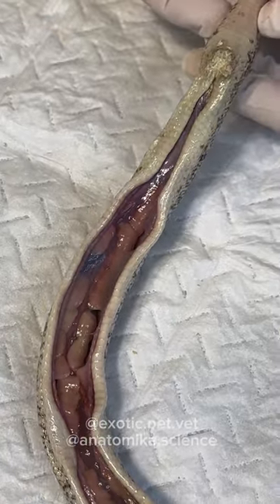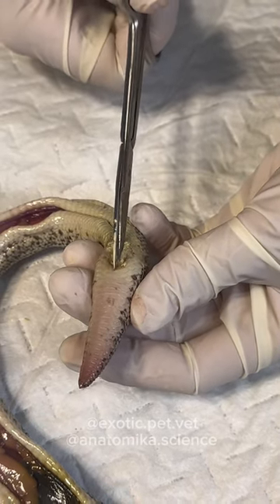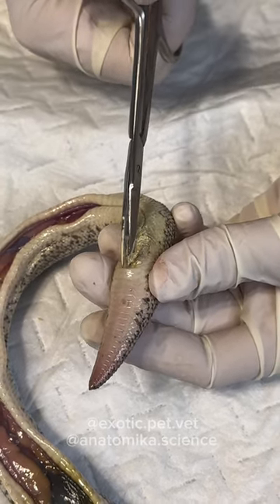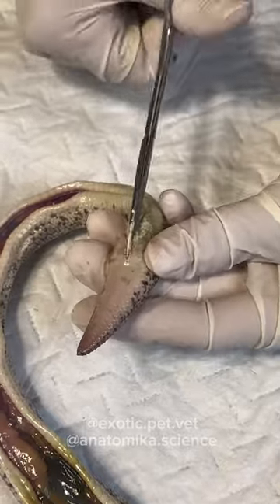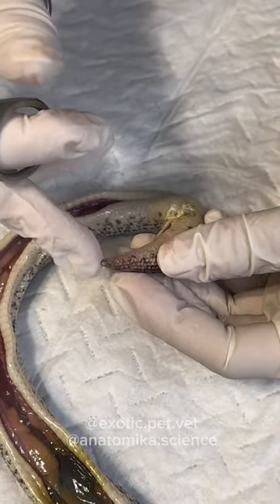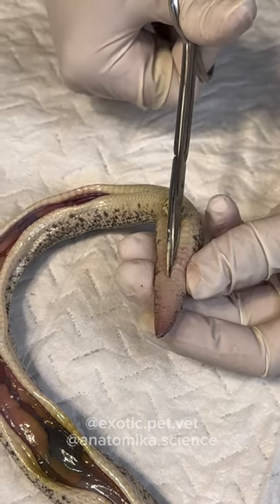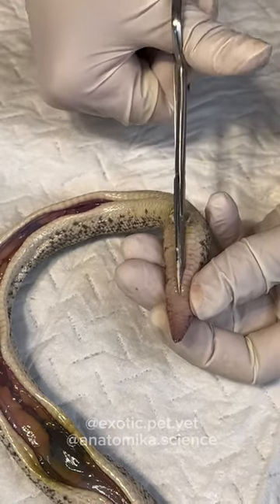What I can do is expose the scent glands. With the exposure, this one will be interesting because the scent glands are so enlarged. I want to make a little cut in the skin — it's very easy to puncture the scent glands. With all these burrowing snakes, the skin is attached directly to a lot of the vertebrae and the bone in the back. What they do is go into burrows and use the tail to block off the burrow — that's why it's really difficult to skin the tails because the skins are so closely attached.